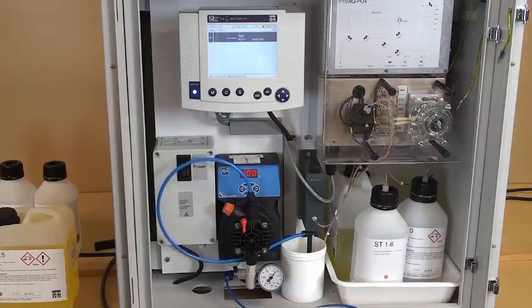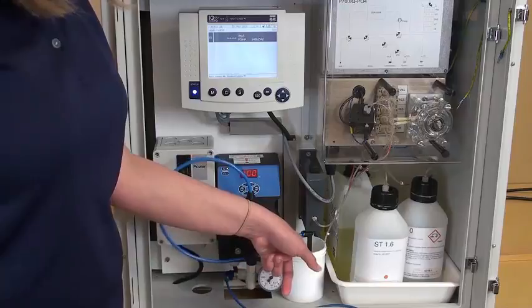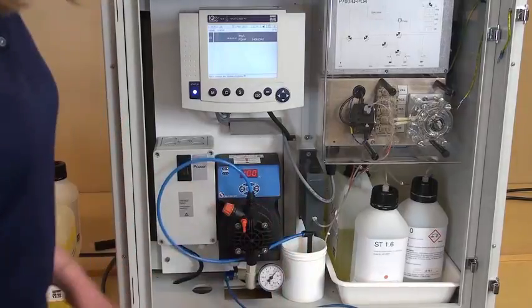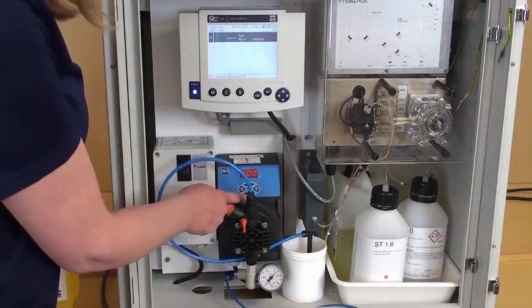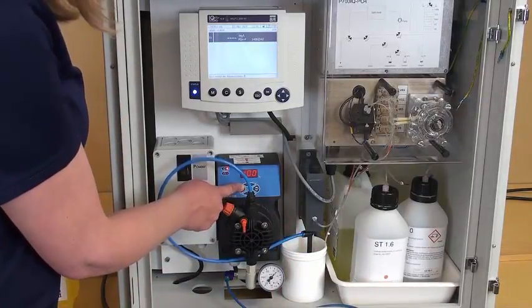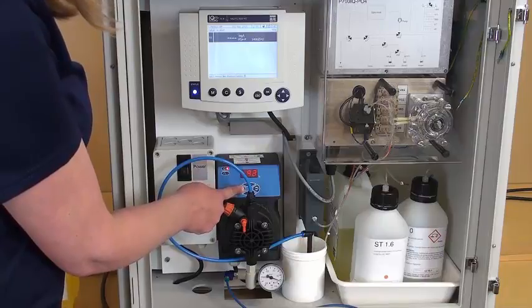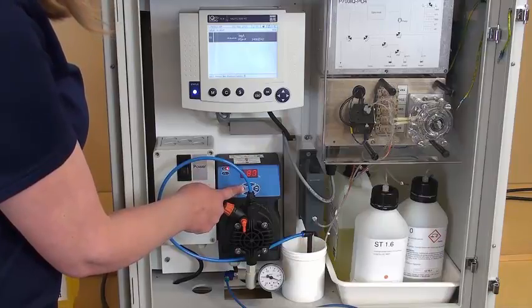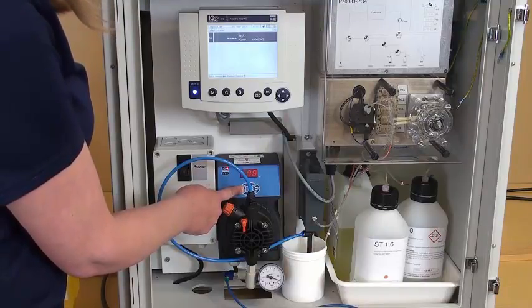At this point, you wait for water to come out of the overflow vessel. At that point, you can stop the pump and lower it down to somewhere between 5 and 10 percent.